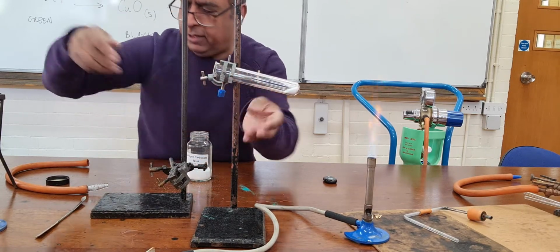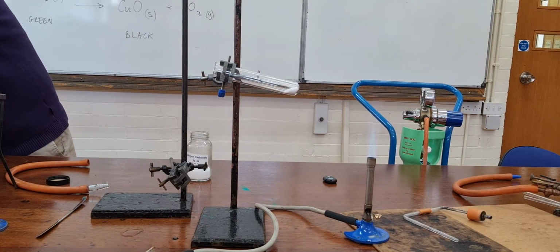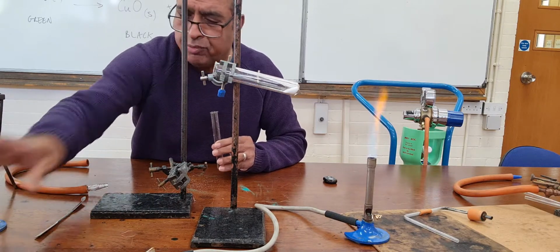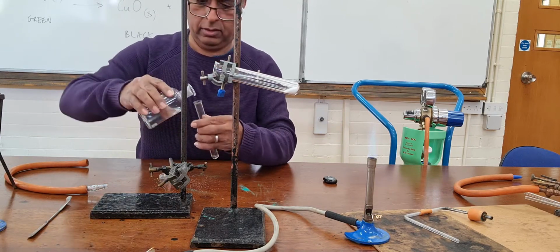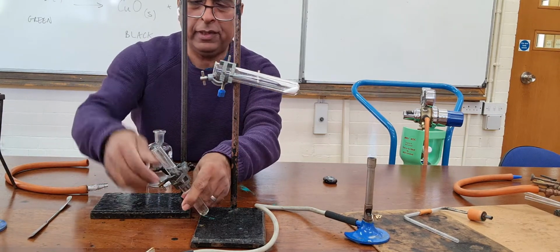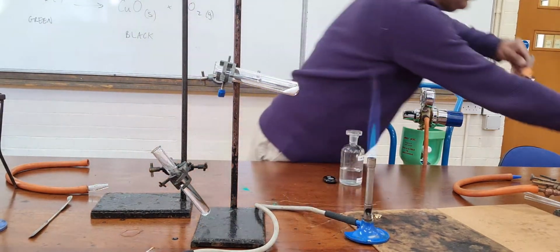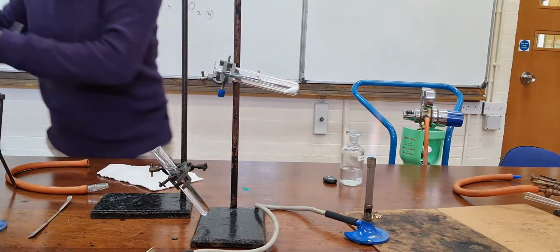I'm going to take a little bit of baking powder, sodium hydrogen carbonate, put that in the same test tube, heat it, and I want you to mentally think. So rinse out this test tube. I want you to mentally think that this baking powder is in some cake mix or some bread mix, and you put it in the oven. And same apparatus, I'm going to put some lime water in here. I'm going to try and do exactly the same thing, just to show you that when baking powder is put in an oven, then the baking powder decomposes in the same way that I've just been talking about.